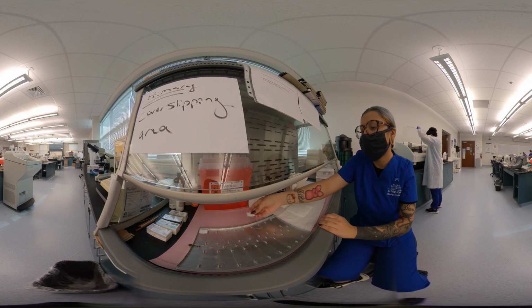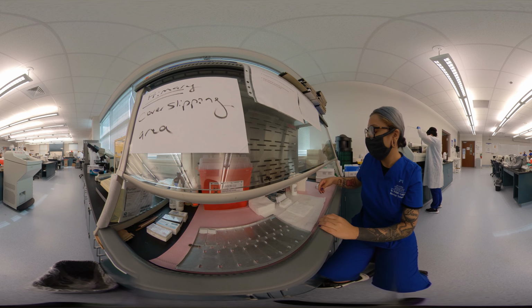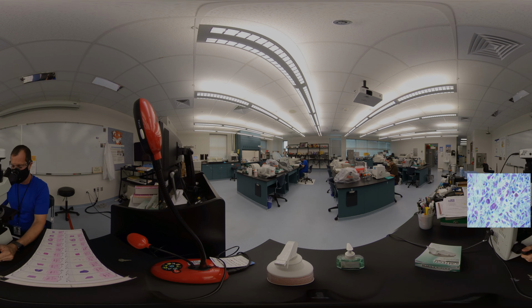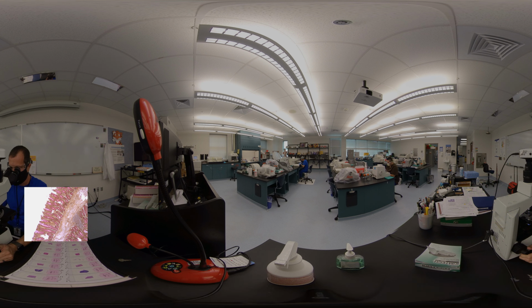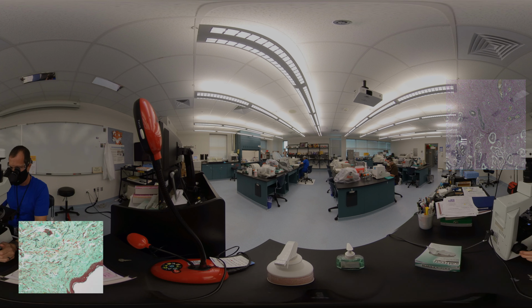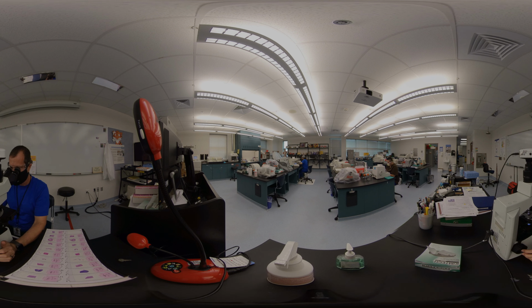Now the pathologist is able to view the slides. During the review, the pathologist will take the information that was generated during grossing and the information on the slide and write a report based on his findings. Those findings are placed in the medical system's records for the patient's follow-up medical care.